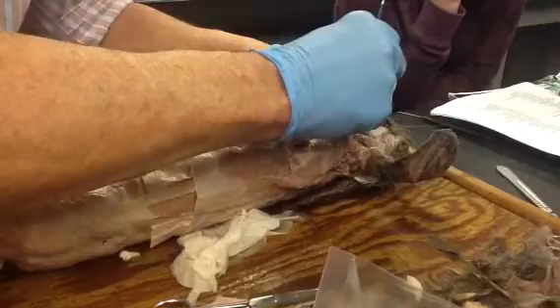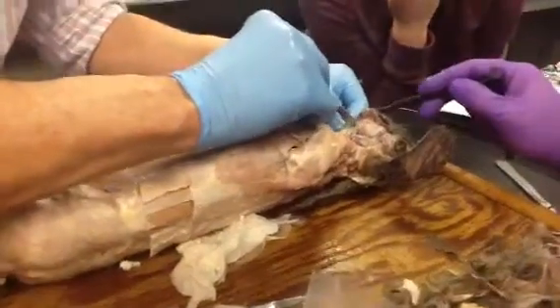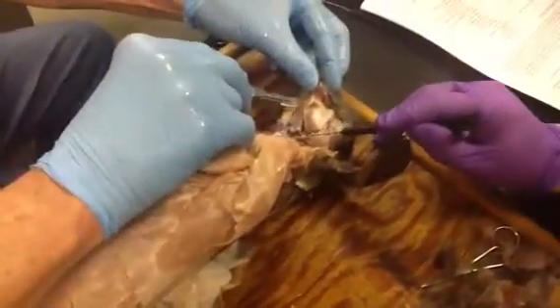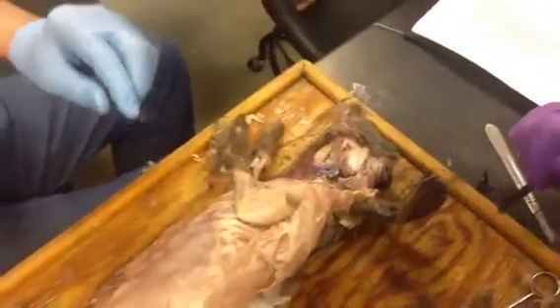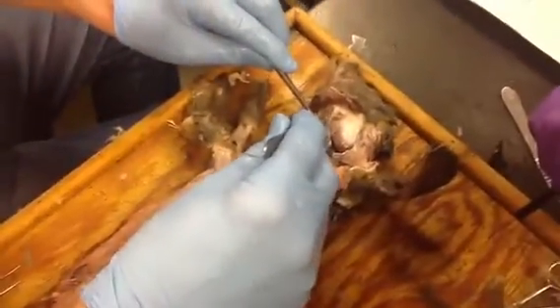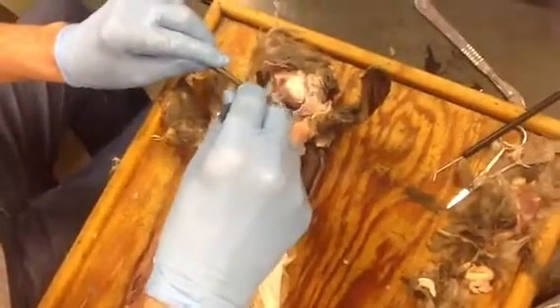And the digastric muscle — that's going to be up in here as well. It runs back to here? Because there's an anterior and a posterior portion. The digastric eventually goes to the mastoid process of the temporal, so back behind the ear. But the anterior belly is right underneath the chin, and it's going back to the hyoid bone.